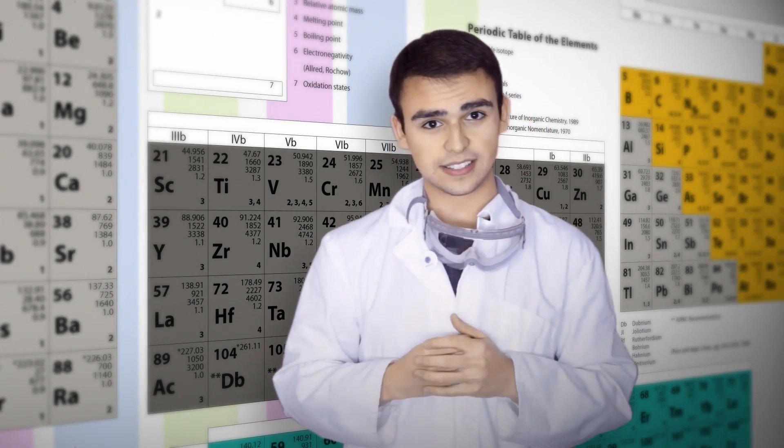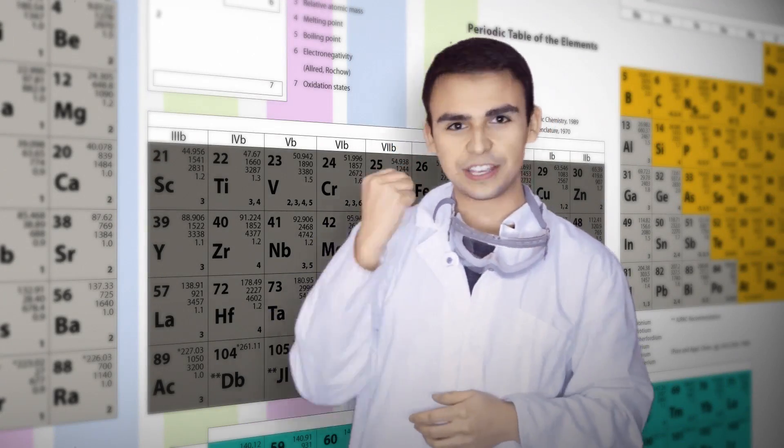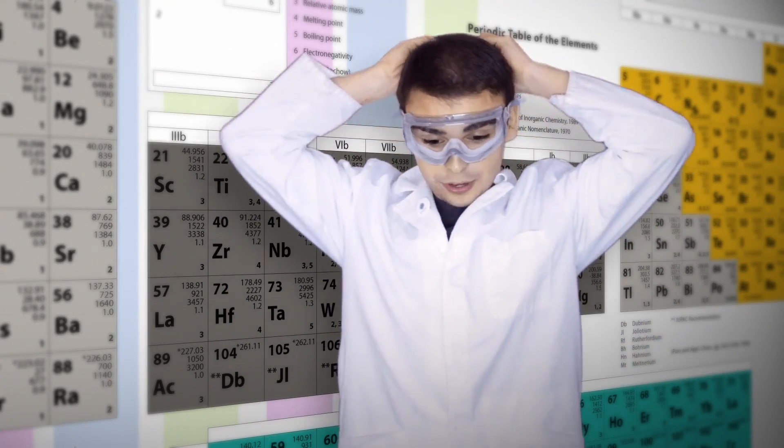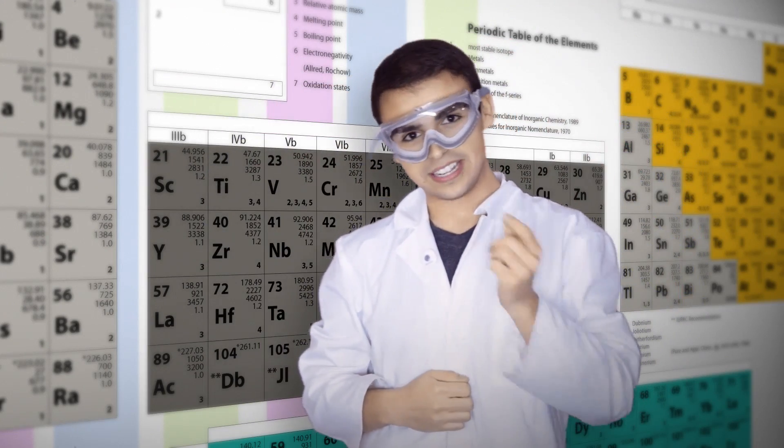Today in Chemistry in Context, we're going to synthesize iodoform by the haloform reaction. First, let's get our goggles on and we can get to the lab.